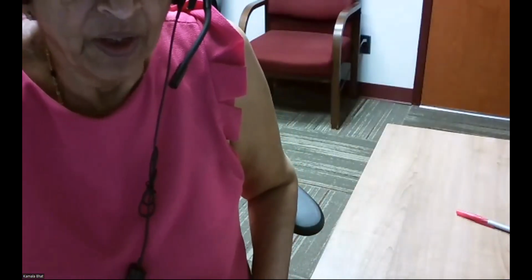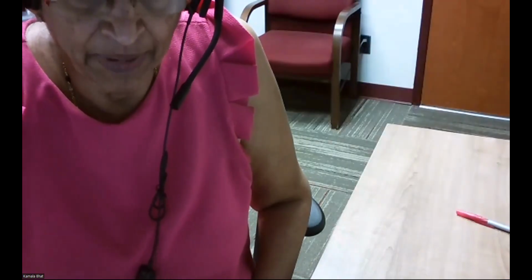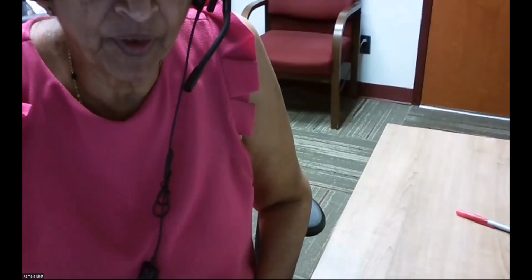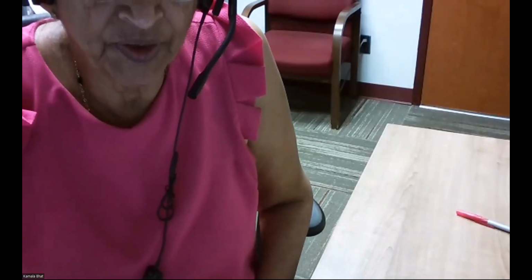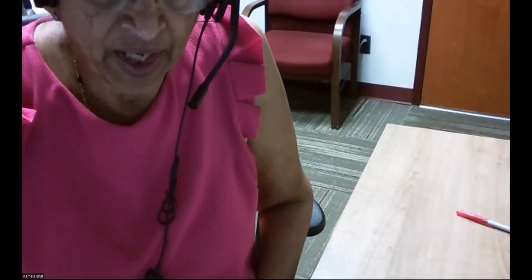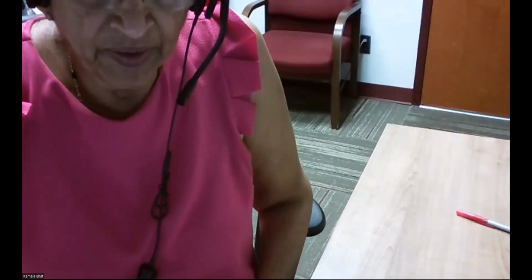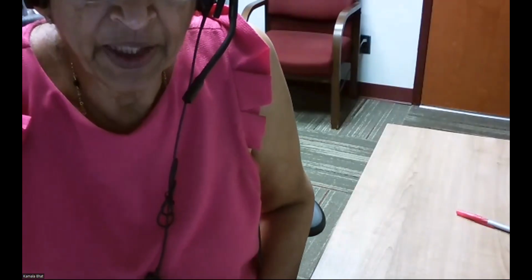Hello and welcome. We are going to do experiment number 8, half-life lab. Half-life is defined as the time required for half the original amount of a substance to undergo a chemical reaction or a change. This particular half-life can be calculated for first-order and second-order reactions.